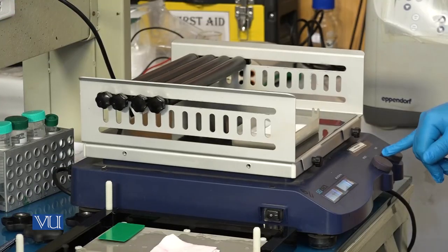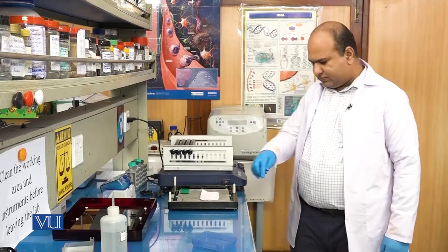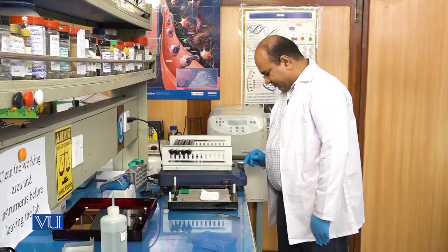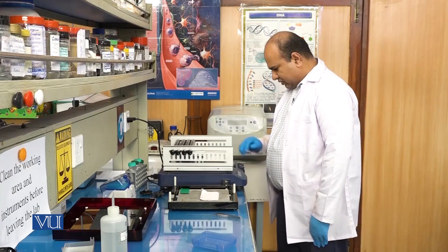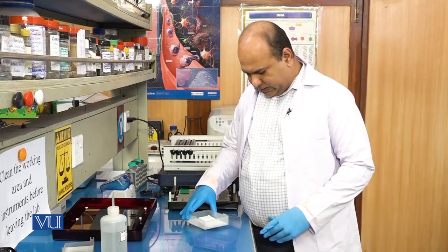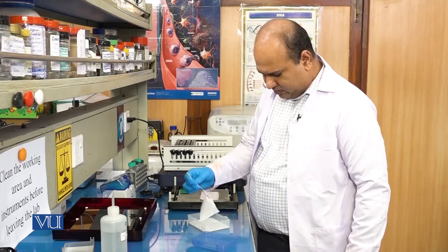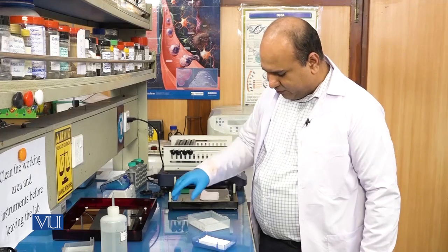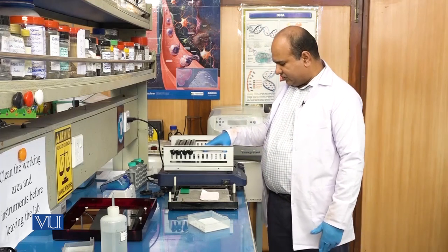We will keep the membrane moving with the secondary antibody for around half an hour. Now the secondary antibody treatment is finished. Let us put it into a wash solution again and wash it the same way as with the primary antibody — three times, five to seven minutes each.